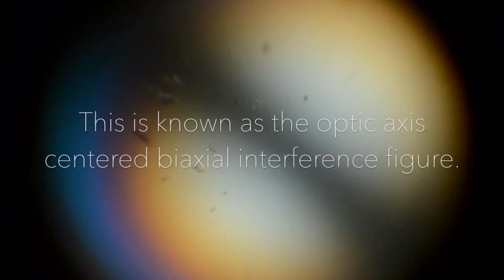The center, or elbow of the isogyre, is where there is an optic axis. This is called a melatope. Since we have two isogyres, we have two optic axes. This is where we get the term biaxial mineral. This is known as the optic axis-centered biaxial interference figure.